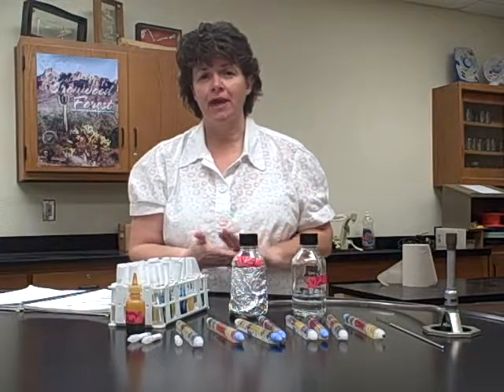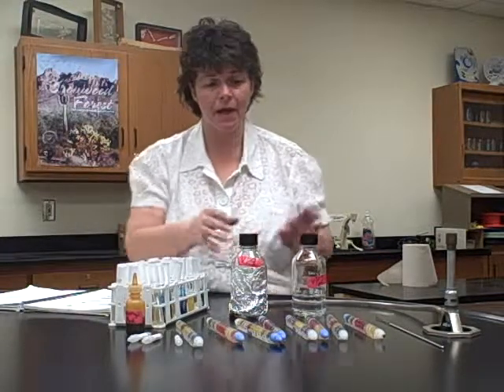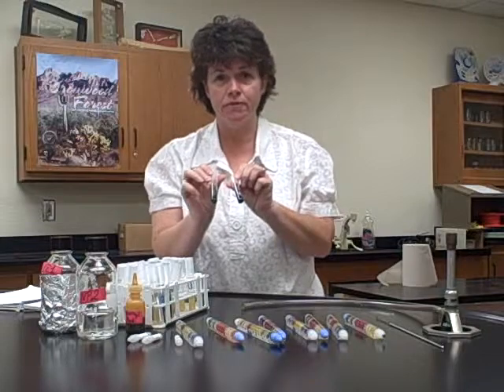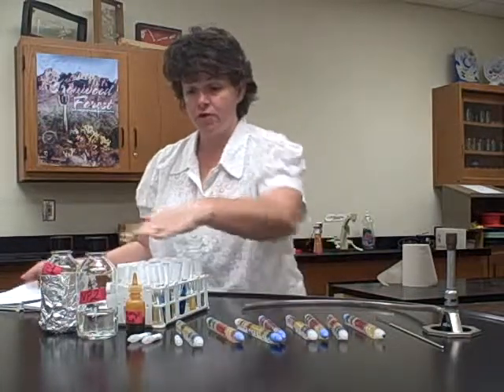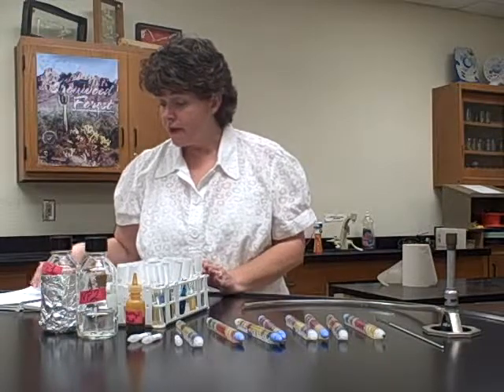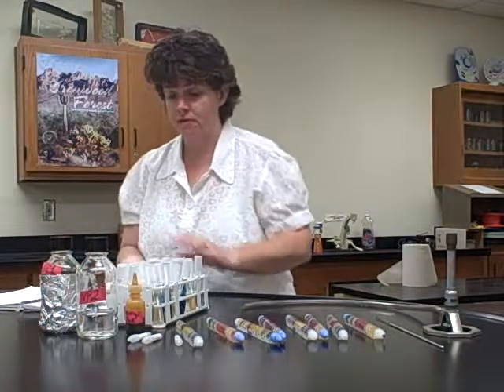Remember, it's very light pink, okay? So that's why you need to do a control so you can tell whether or not it is positive. The last one was the citrate, and so recall with the citrate that if it turns blue, that's a positive test, so that one's pretty easy. So for those, you will record the results where it says IMVIC on page 113. That is separate from these. You don't record any of these results on those 4 lines. That is only for these, okay?